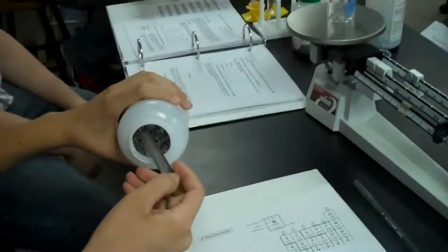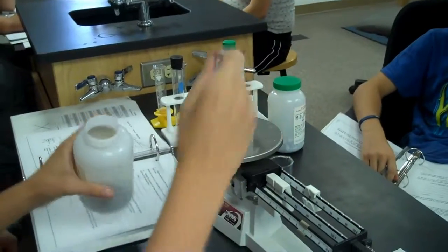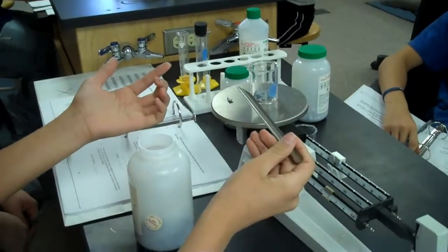Smells gnarly. Don't smell it. Oh, well, too late. I thought that was why we went over that in the lab safety video, wasn't it? Dude, that whole thing, as you would say, was rhetorical. Can I touch this? A little late, isn't it?